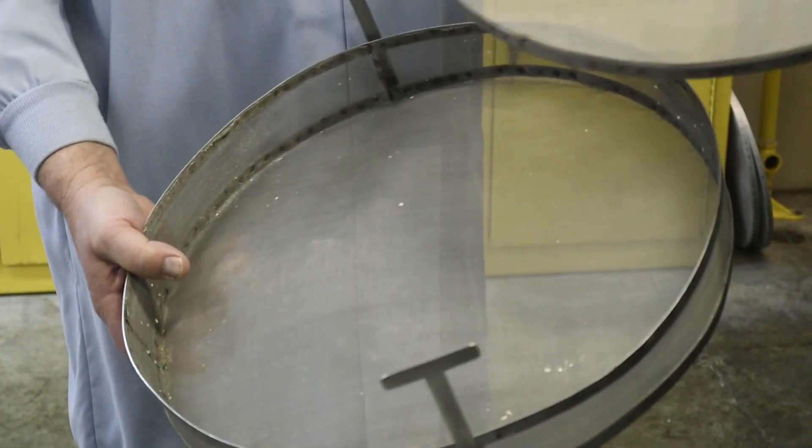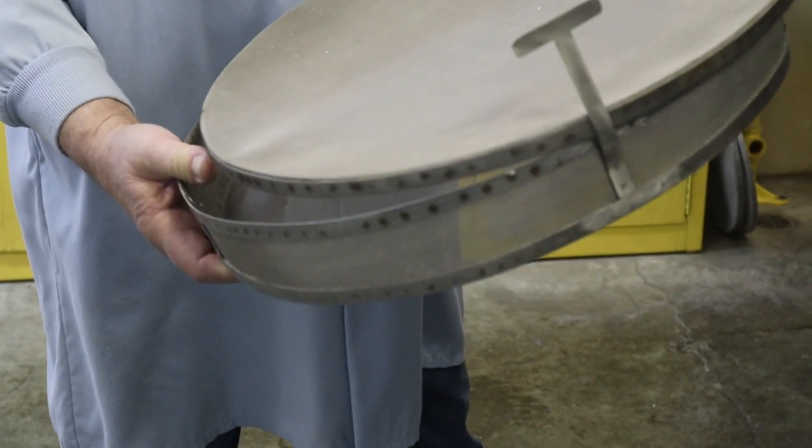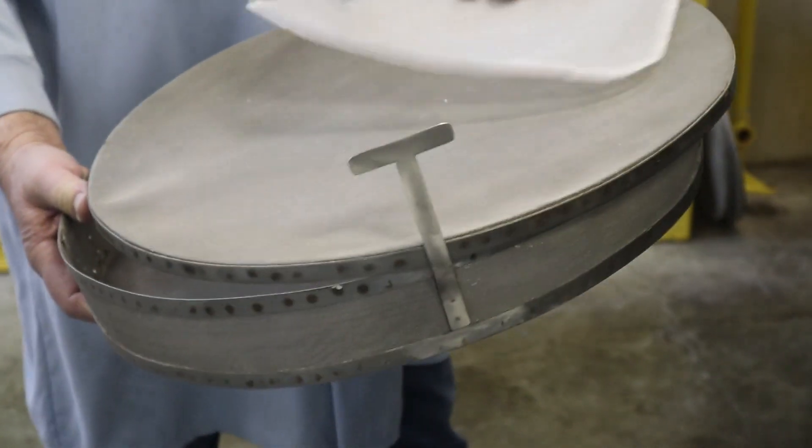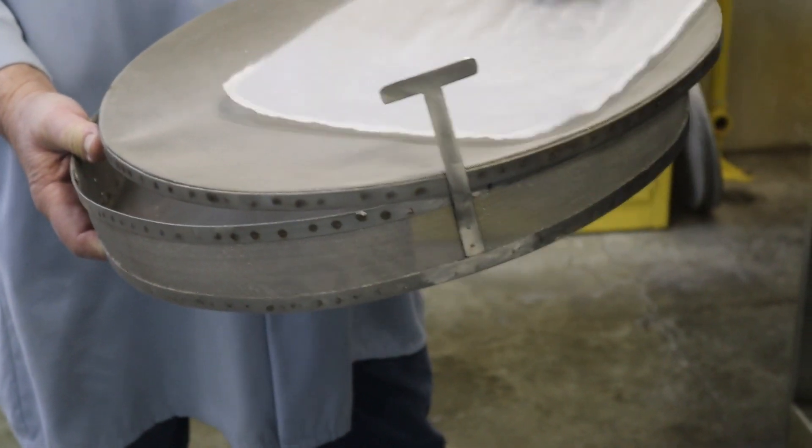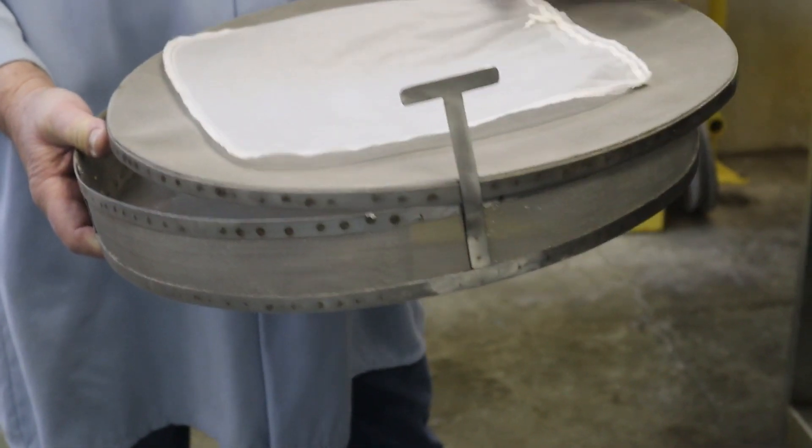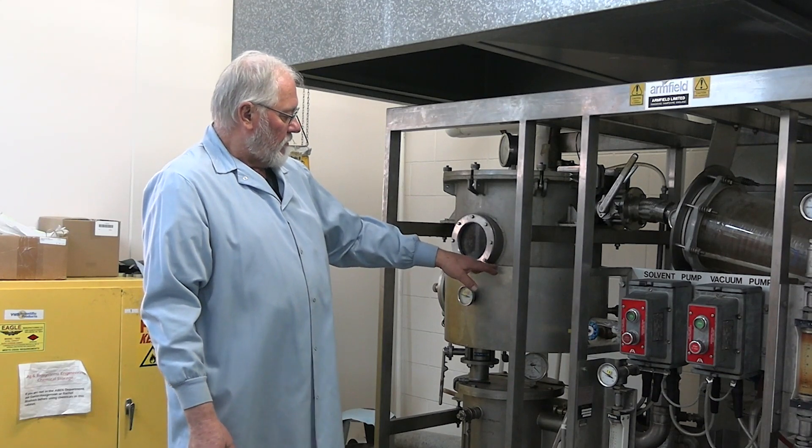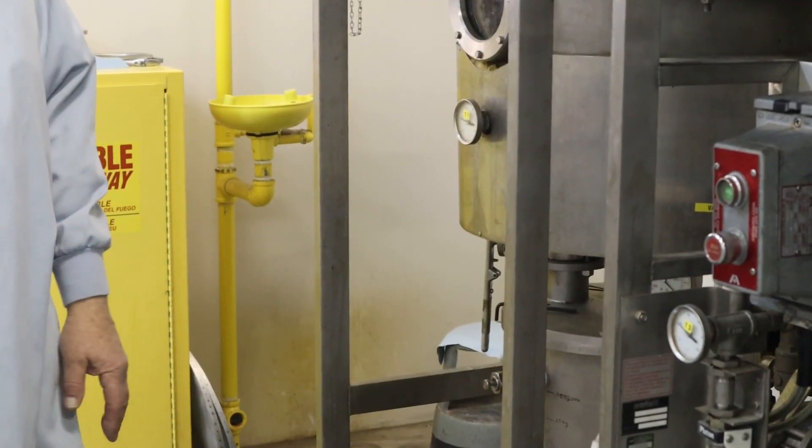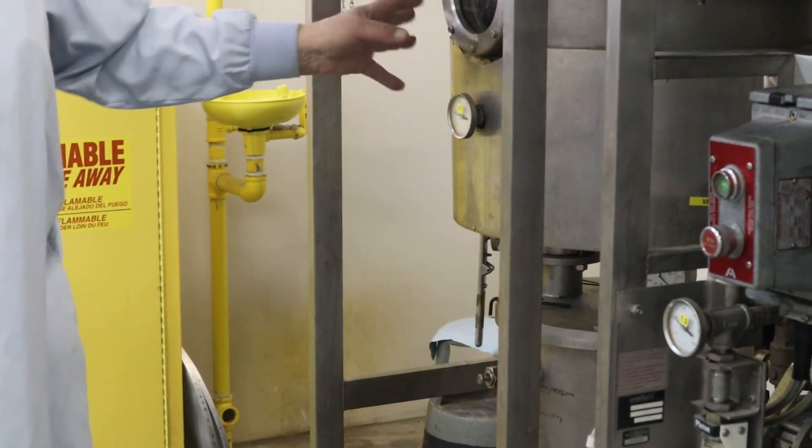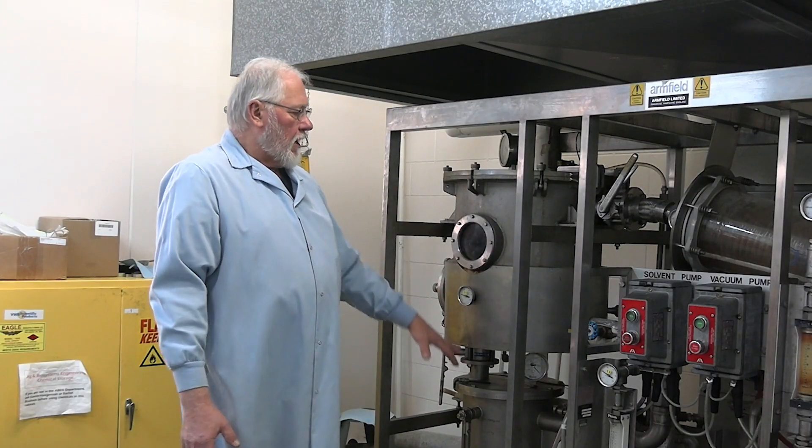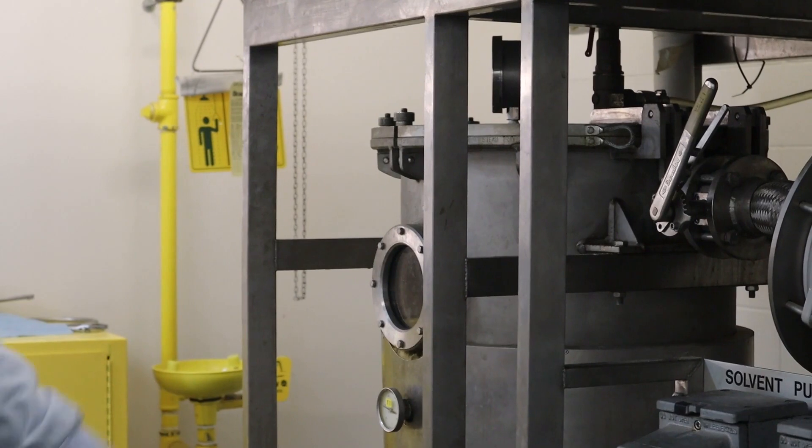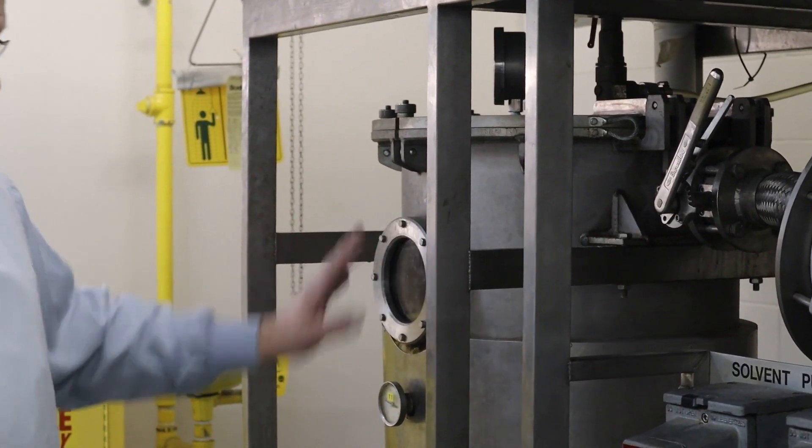Or in some cases when I'm doing small samples, I may put as many as 10 or 12 little bags like this. But I have three of these baskets that go in there. They fill the chamber about this deep with those baskets. Or I've also used this unit where I'll put flakes in approximately that deep and then solvent is sprayed in there. Again, this was the extractor.